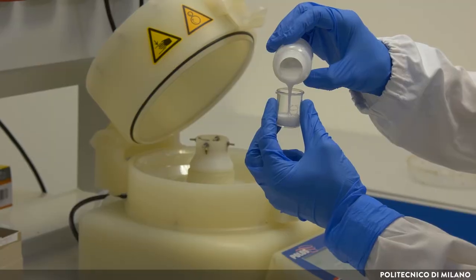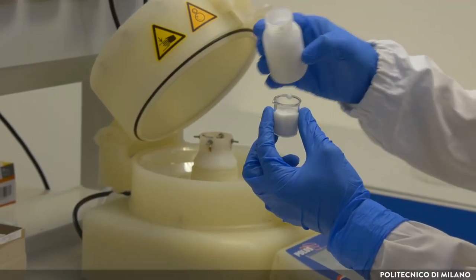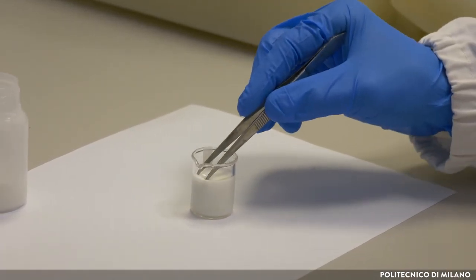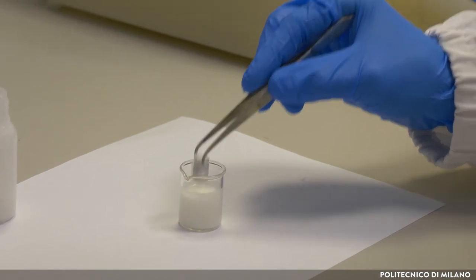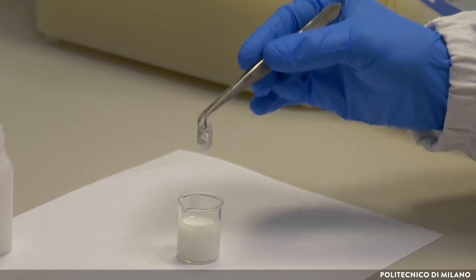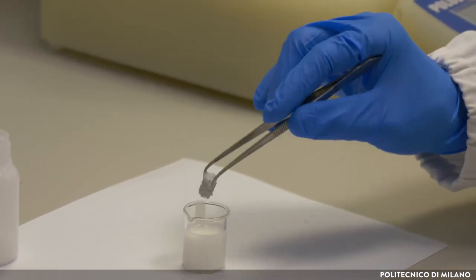After this time, the slurry is racked into a beaker. A metallic foam represents our support. We immerse the foam into the slurry until all the support is covered, and the extraction of the foam is made vertically and with attention.